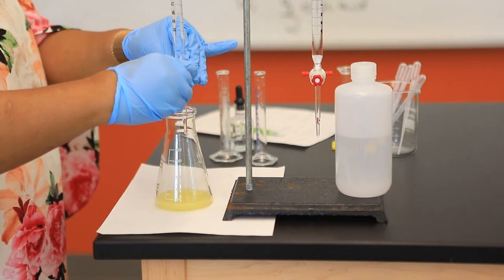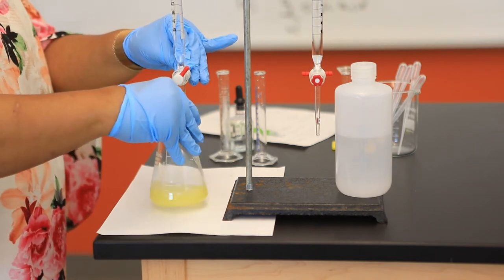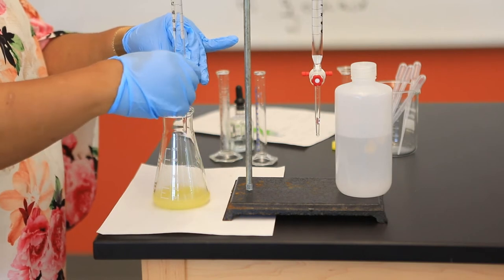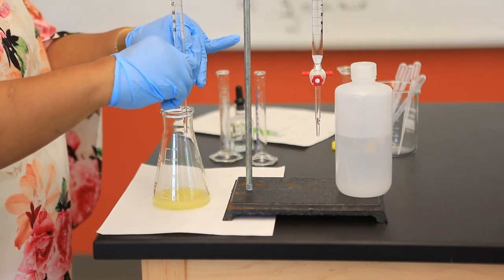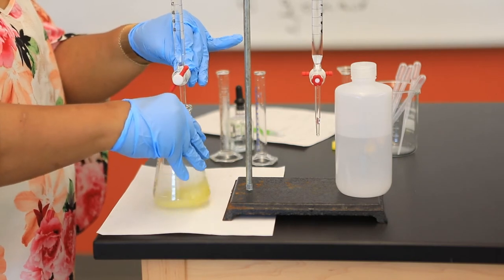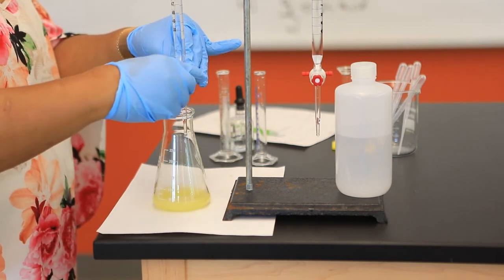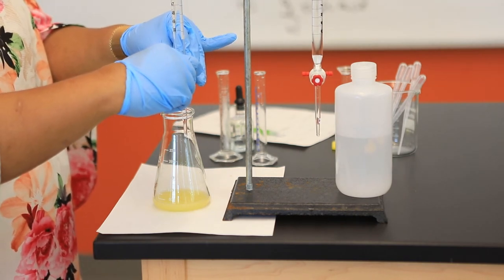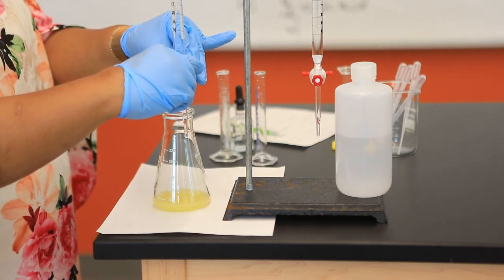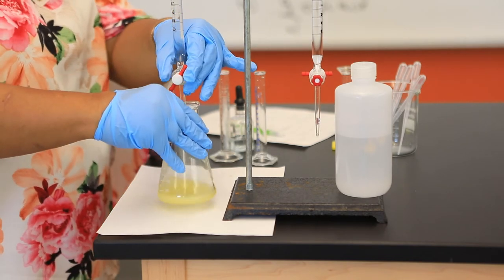Just as we did last semester, as we near that end point, we want to make sure that we add our solution gradually. I'm going to proceed now, adding my NaOH about one drop at a time, trying my best to control the rate of addition.